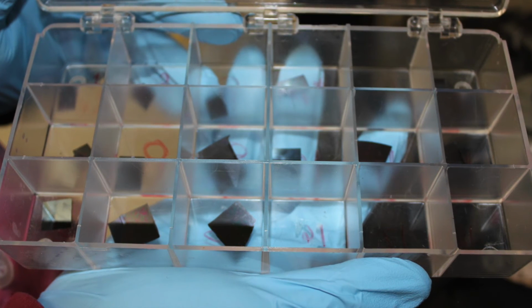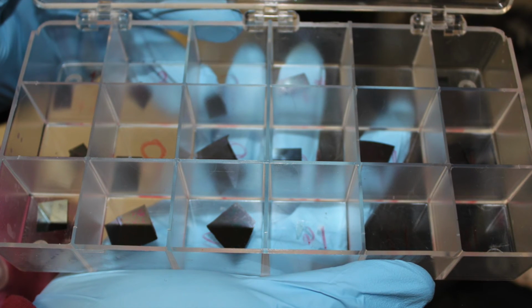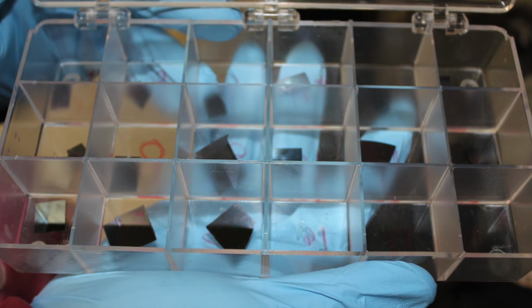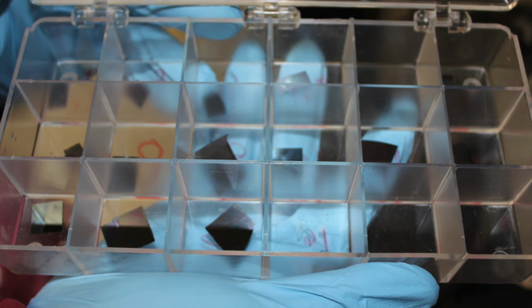In addition, stage temperature was not accurately read or controlled due to a poorly placed thermocouple. The filament temperature also was not digitally controlled, which led to inaccuracies and temperature fluctuations. These 3 factors would need to be addressed and fixed before retesting the experiment.